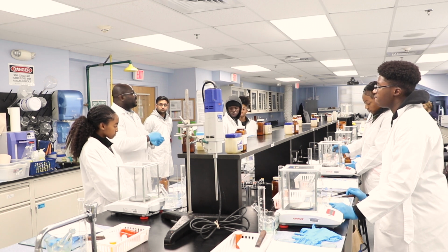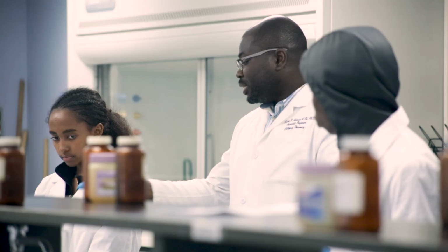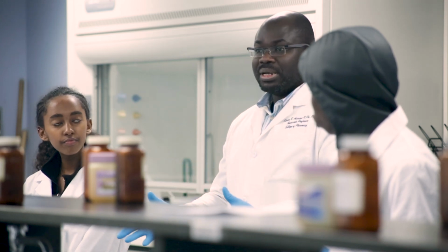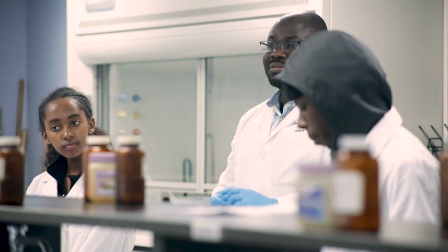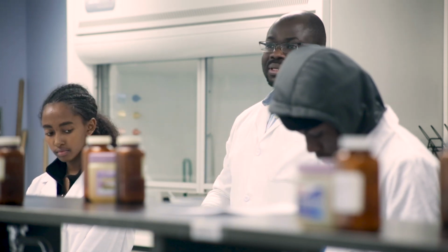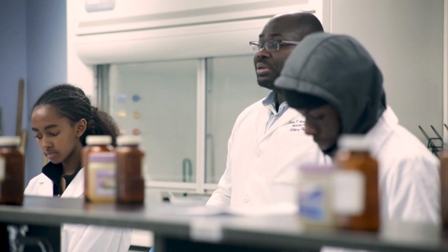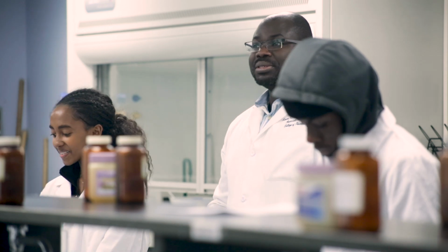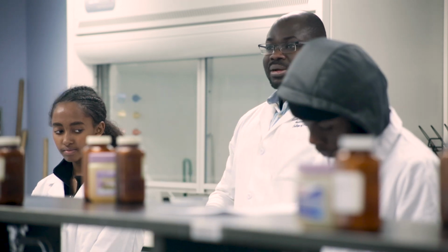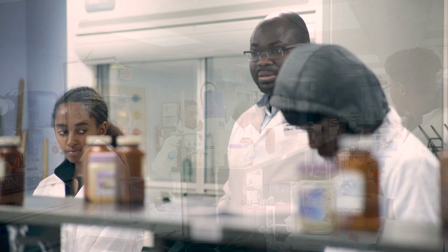But when you are filling your capsules, you're going to lose some of the powder. You will not get enough for 8. So I put it in the procedure that we should calculate for 12 capsules. Now if you calculate for 12 capsules, each capsule contains 50% of drug A and 50% of lactose, right? So if you are making 12 capsules, your drug A will be 125 milligrams times 12. And the lactose is going to be 125 milligrams times 12. And then you're going to mix these 2 together. And when you mix this together, then you fill each capsule with exactly 250 milligrams.